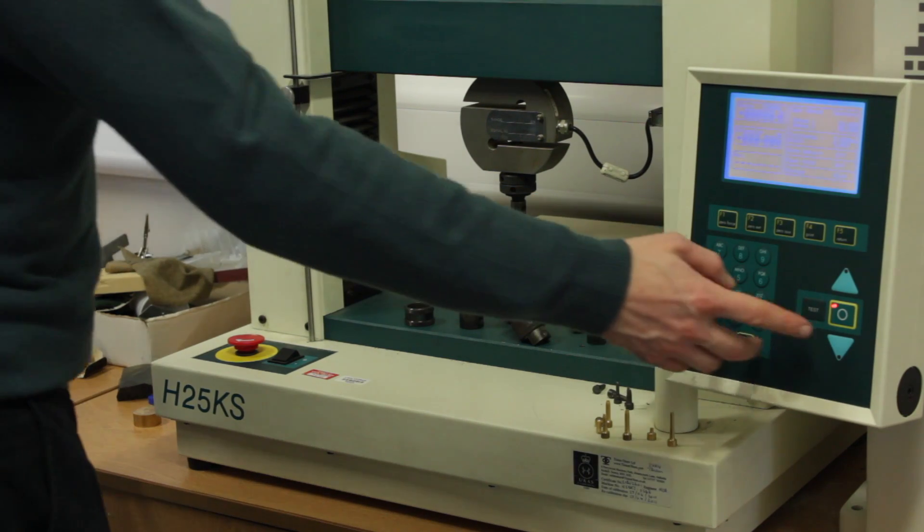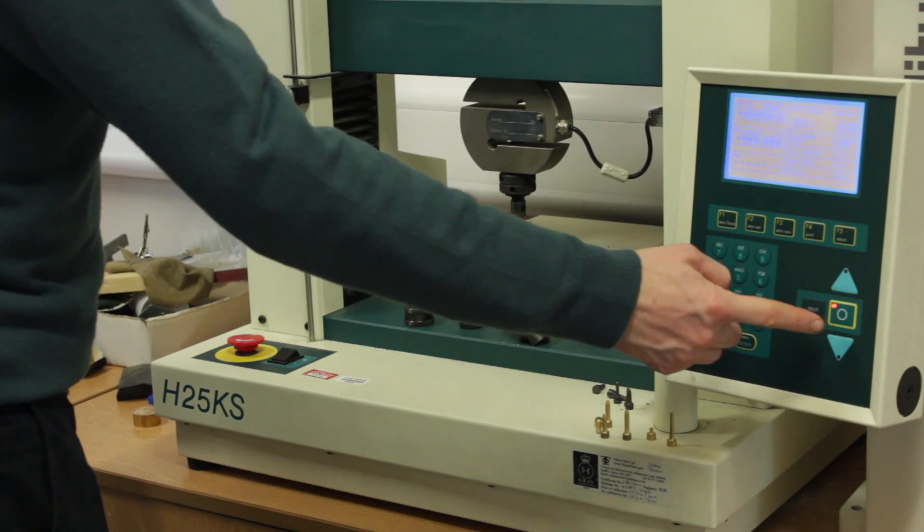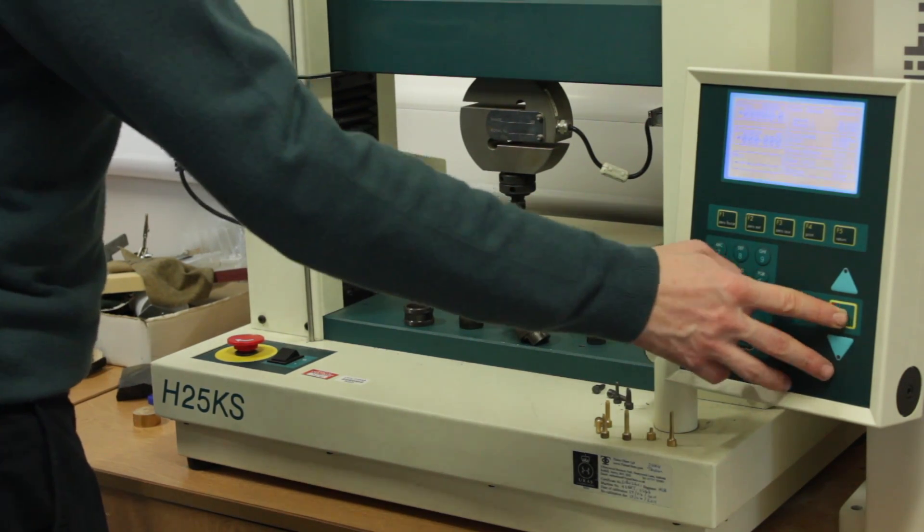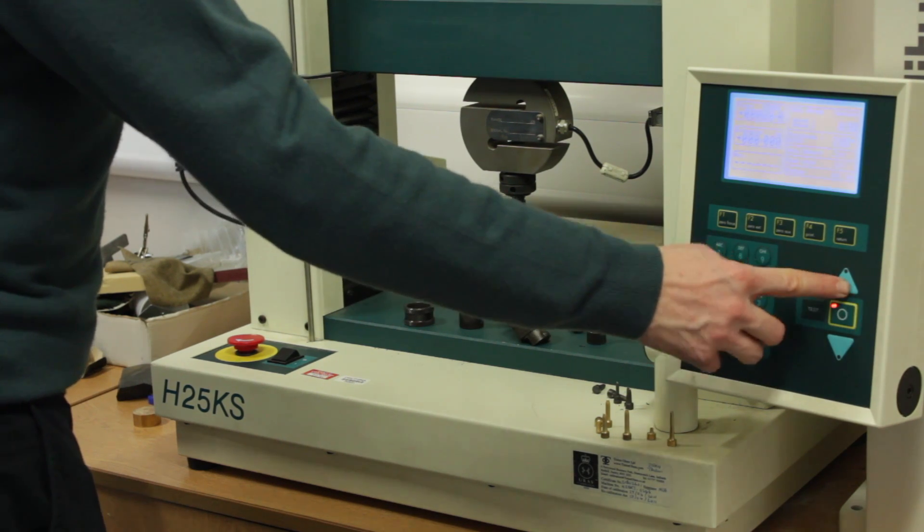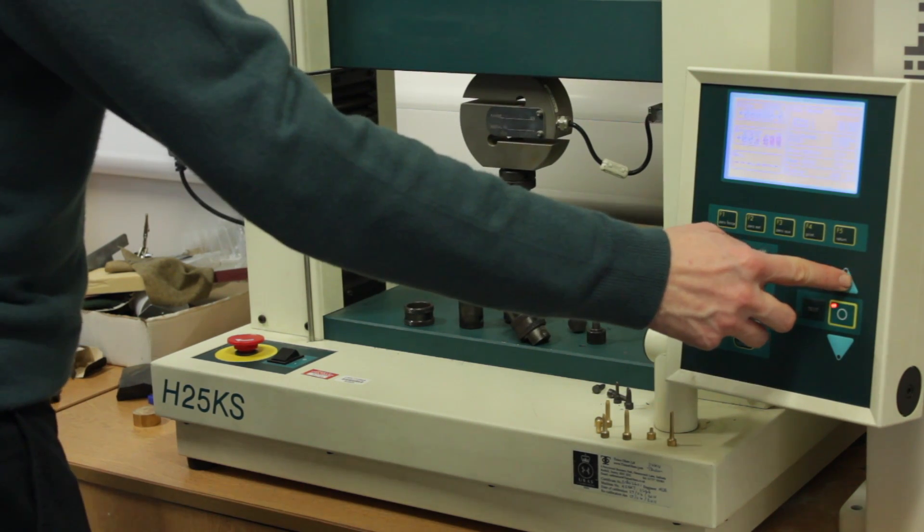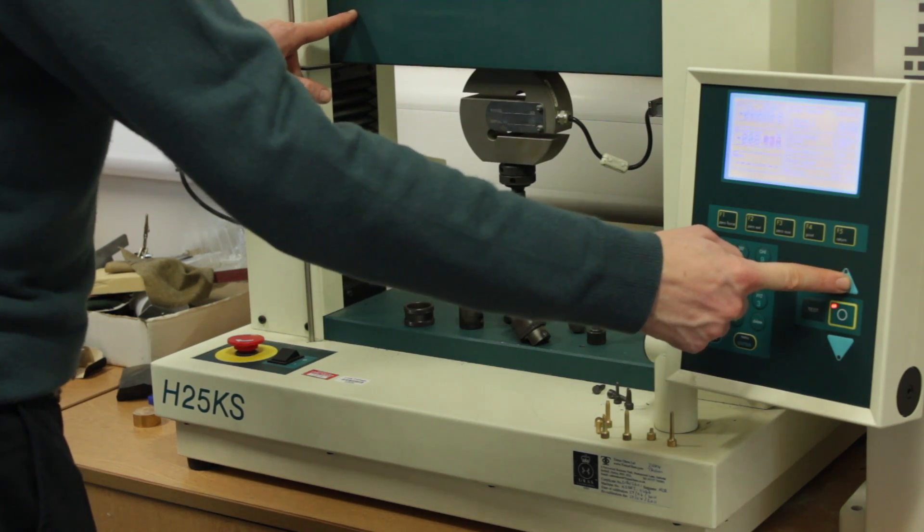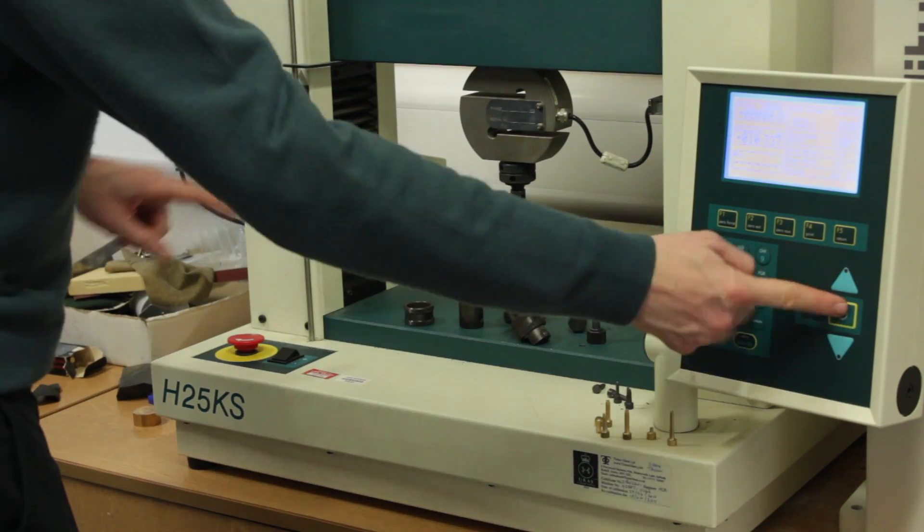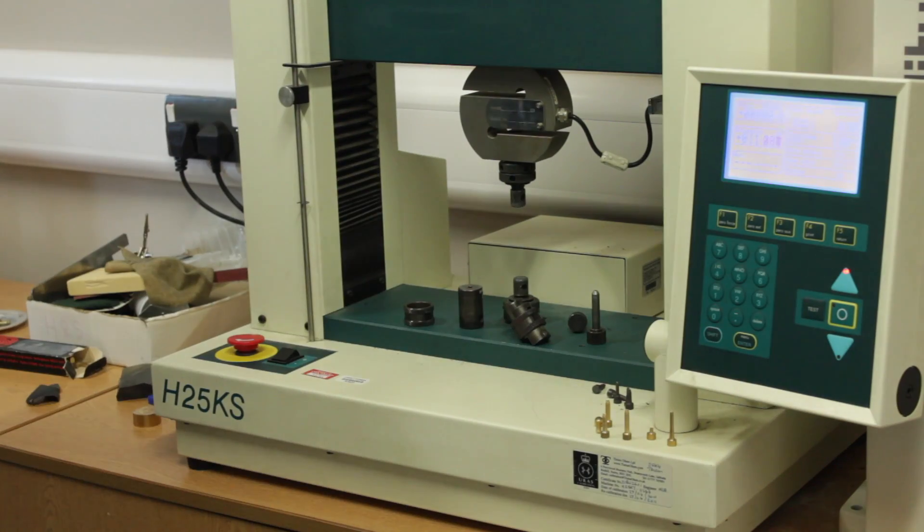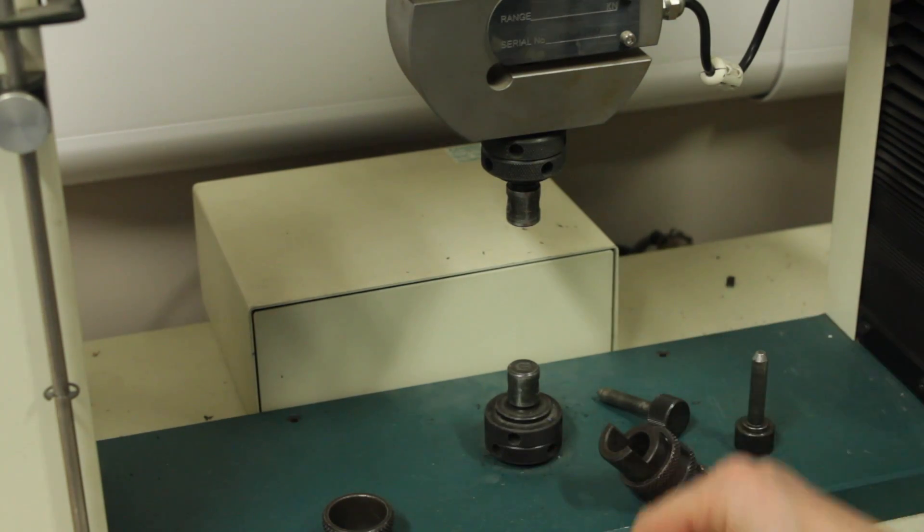Next we'll need to be able to jog the machine. There's two modes, the first is incremental jog mode. To do this, press the circular button so the LED is flashing and the up button will jog the main bar by a predefined amount, generally a millimeter or so. In continuous mode, that's the solid LED, the bar will move of its own accord.